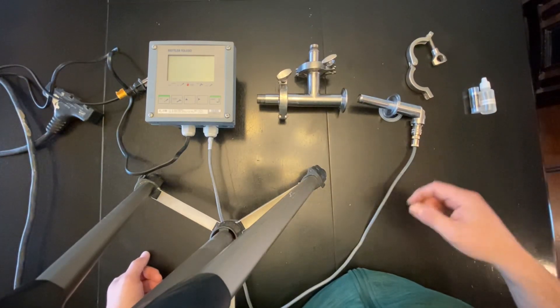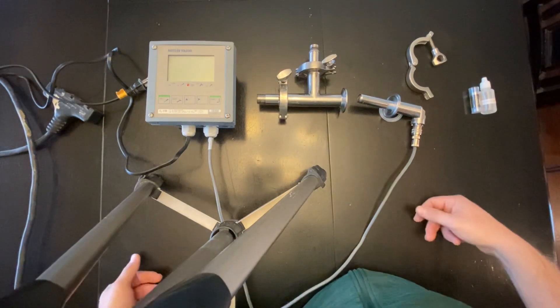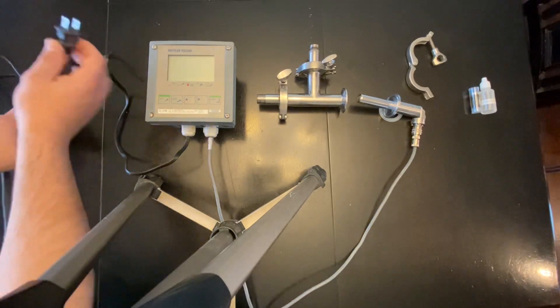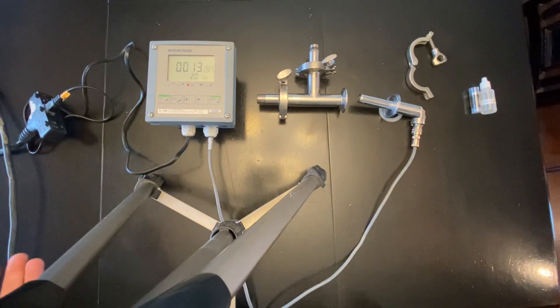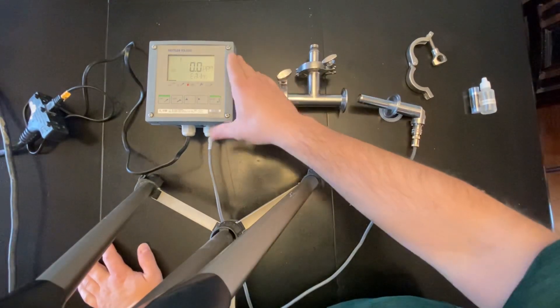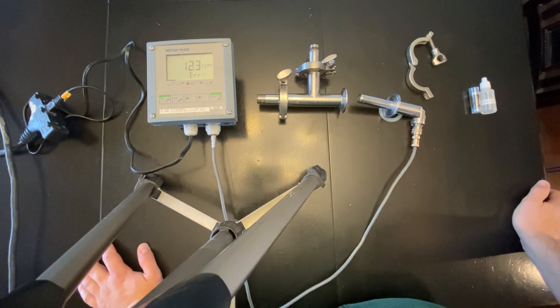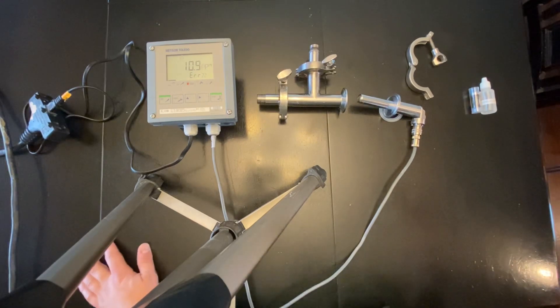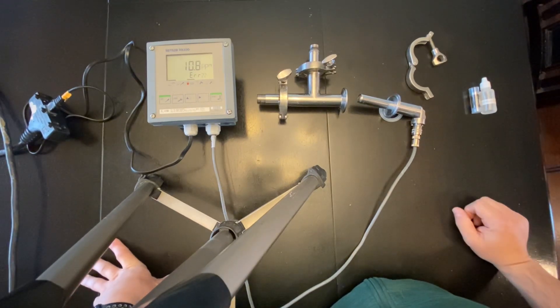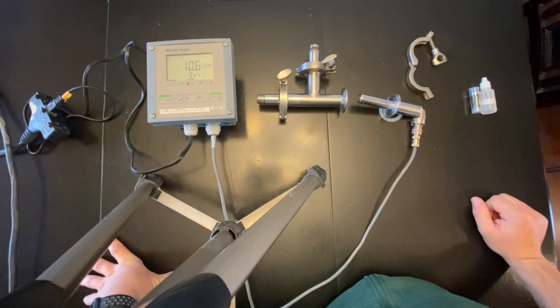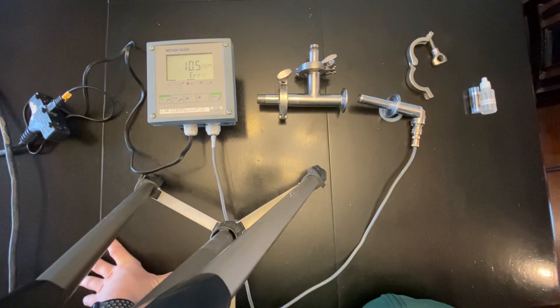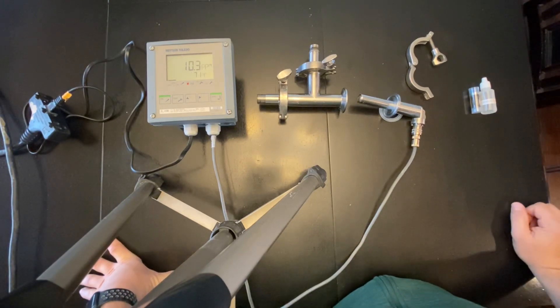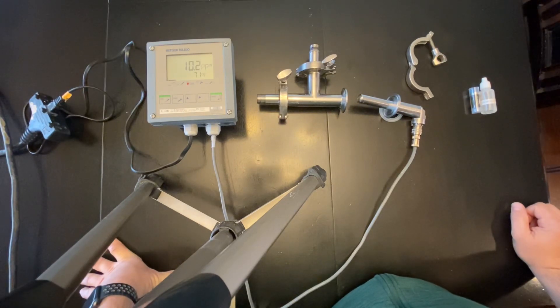As far as the meter, it's just going to be a standard connection like this. You plug it into the wall, it will turn on, it will start reading DO. You'll want to keep this thing plugged in for about an hour or two before you want to use it so it'll be able to stabilize. Once that stabilizes and we do a calibration, then you're all set to use this for the day.